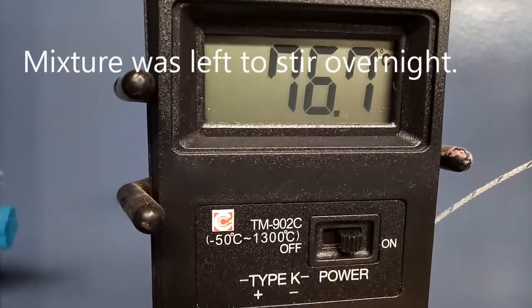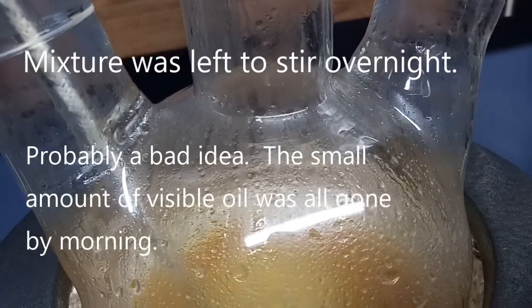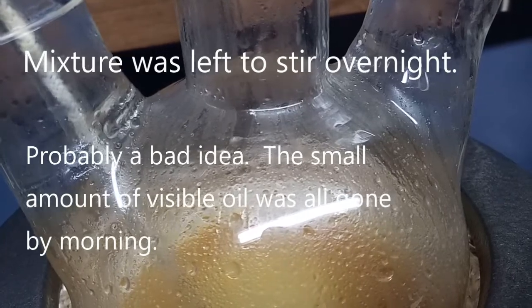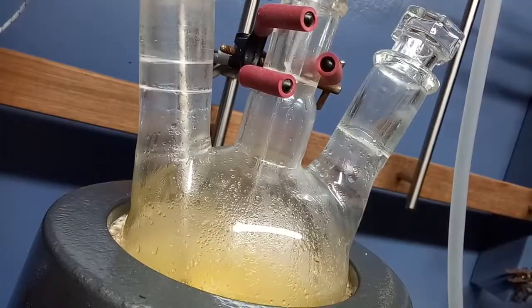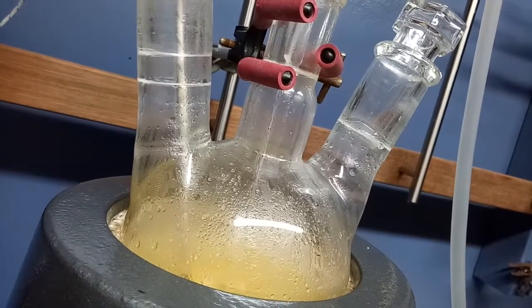Another problem I had, which you probably spotted, was the fact that I let the temperature creep up. The procedure called for it to stay at around 70 degrees, but it got up to, at one point, about 78 degrees.